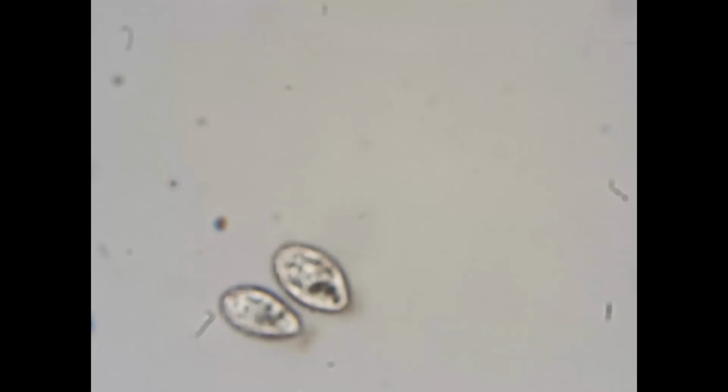I'm going to adjust the position of this slide to try and center this group of 3 tetrahymena. Increasing the magnification narrows the field of view, so you always want to have your subject centered before you switch objectives. Now I'll go to 100x magnification. A little out of focus again, so I'll adjust with the fine focus knob. A better view here, but it would still be difficult to count the vacuoles. So I'll center that cluster again, and move on to 400x magnification. Now we'll be able to get good resolution on these vacuoles.